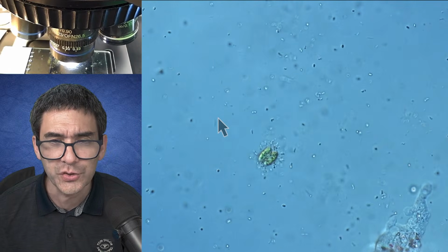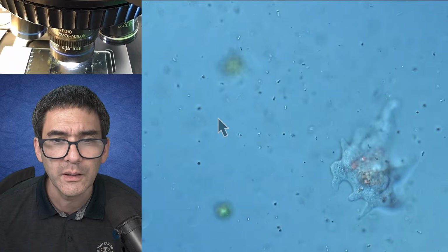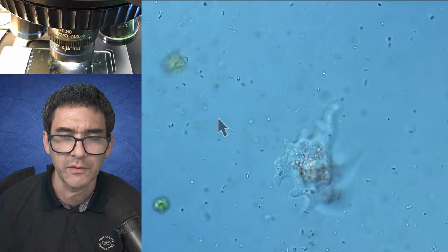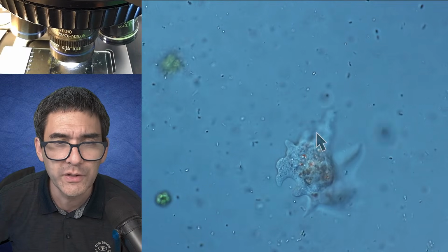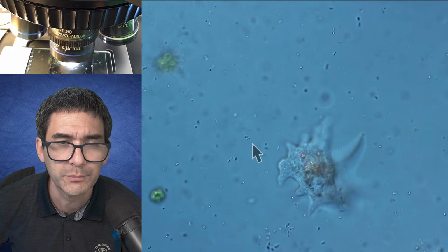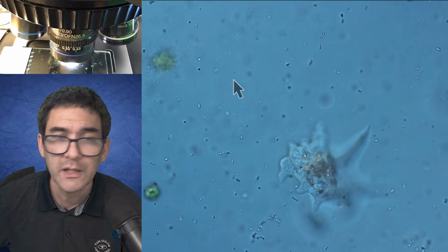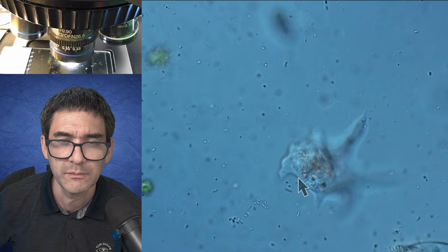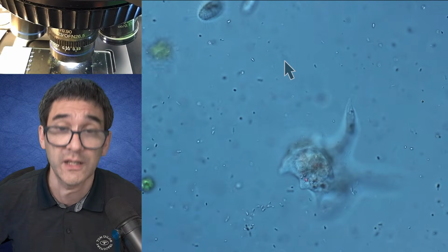This is actually also quite nice, indeed, the size comparison. What we have over here is, I mean, cell sizes have quite a range of difference, but you see over here an amoeba, a eukaryote with a nucleus, right? The bacteria here, prokaryotes. The algae over here, also eukaryotes, and the rotifer, which is made of around 1,000 cells.